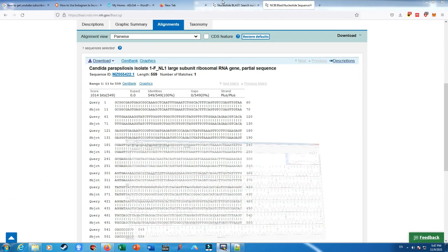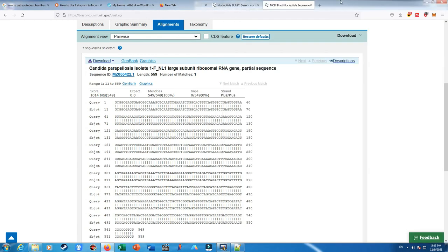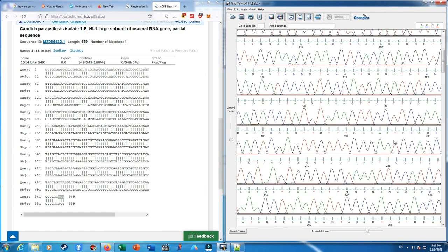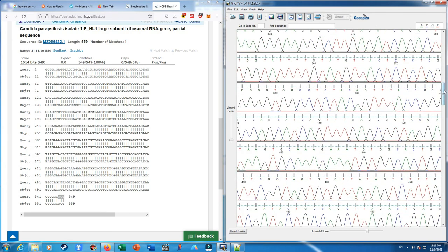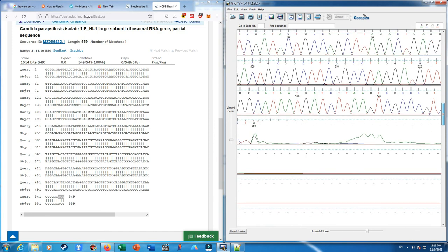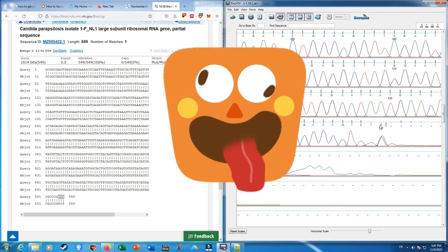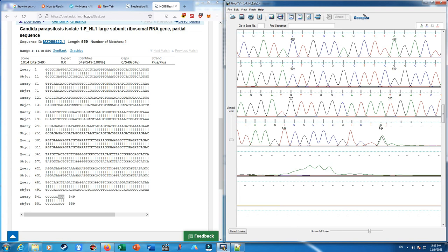And if I go back to the FinchTV, let me see what was the end of our sequencing. Our results end with TCT, and let me check it in here. What was the last nucleotide stretch of our data? It was TCT. Okay, so the two end nucleotides which I agreed to be in the result weren't actually there. It's because our reduced amount of BigDye fluorescent in here overlapped with the end of our sequencing.